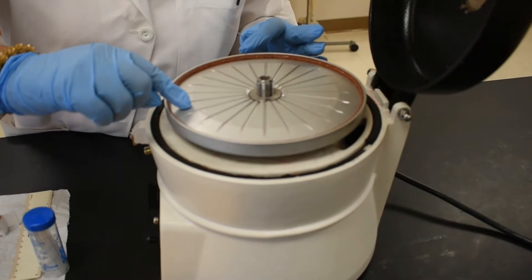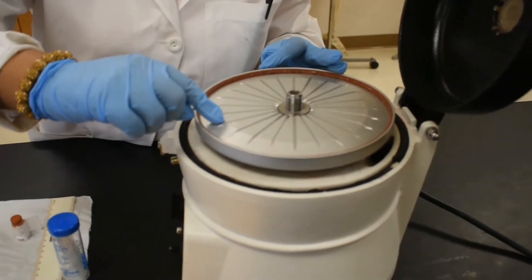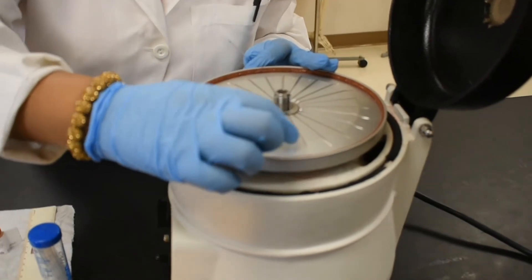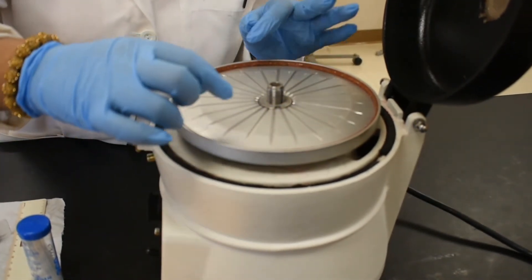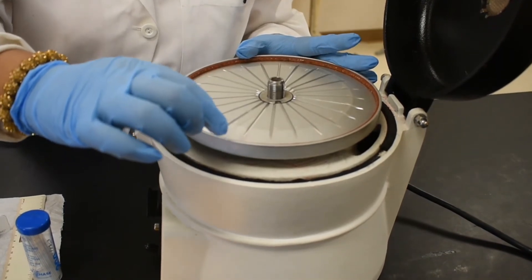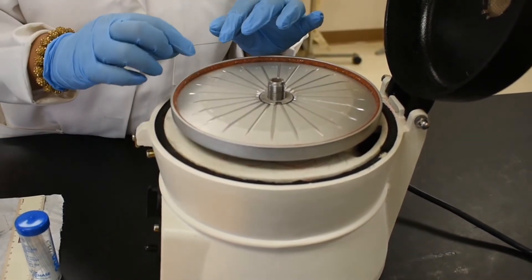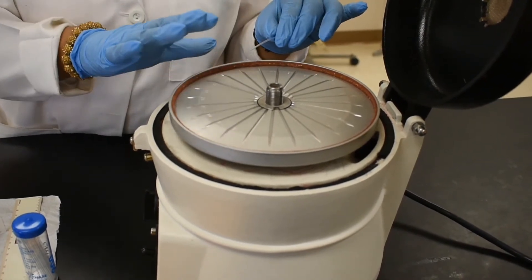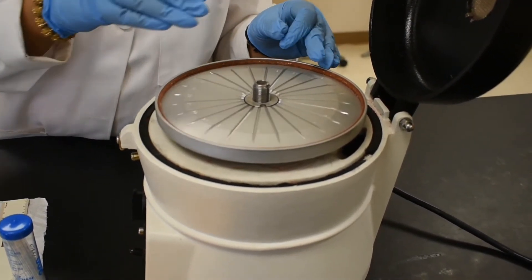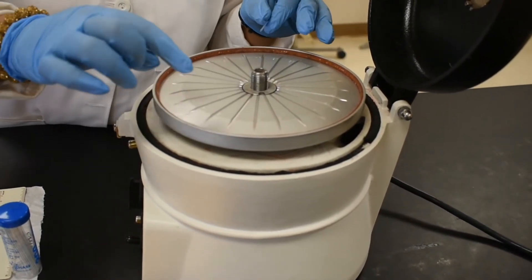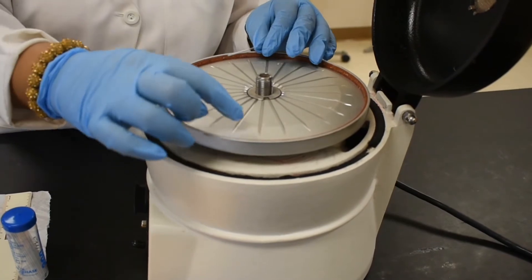Another thing, if you notice carefully, on the side of each slot there is a number. So when you put your sample, note the number where you are loading the sample. If you are the only one using the machine, there is no problem. But if there are multiple people or teams using the machine at the same time, we will track it by the number.